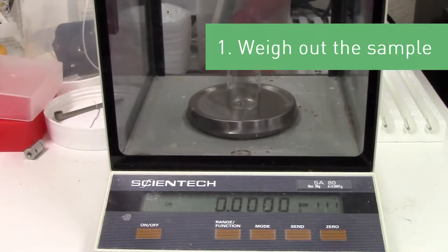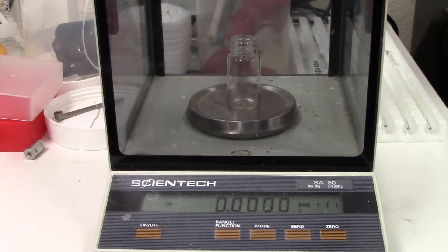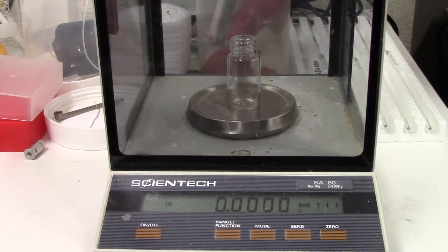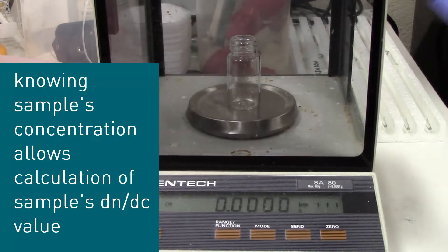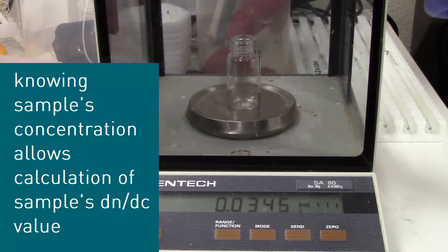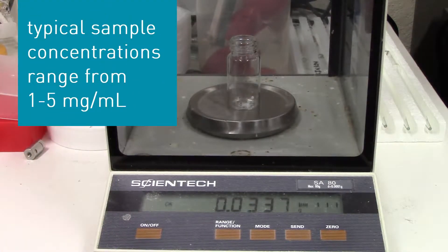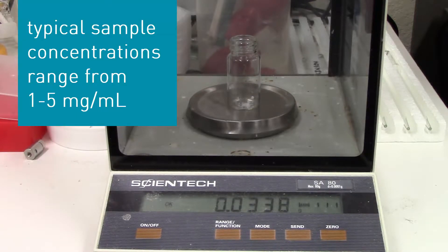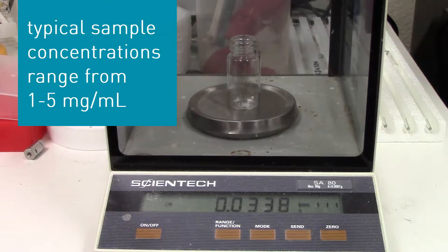The first step is to weigh the sample into the scintillation vial. This way, if complete dissolution occurs, the concentration of the sample will be known. Knowledge of the sample's concentration allows you to calculate the sample's dn/dc value, which ensures accurate data calculation and obtain additional information, such as percent recovery. Typical sample concentrations range from 1 to 5 milligrams per milliliter, depending on the sample type, so make sure an appropriate amount of sample is weighed out to meet the desired sample concentration.